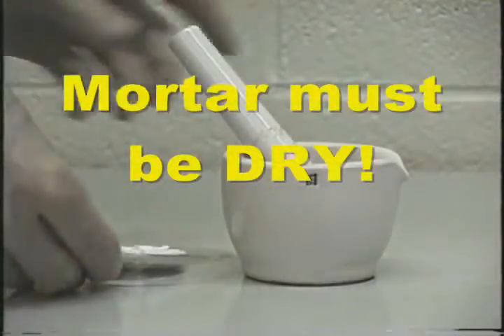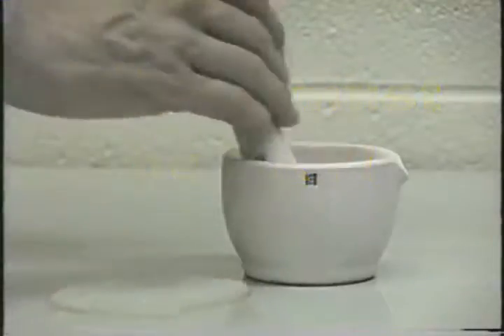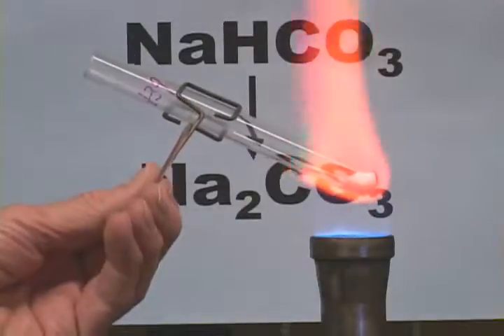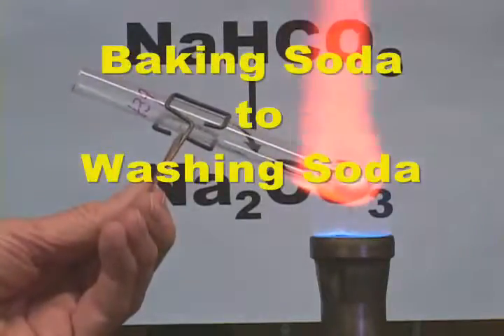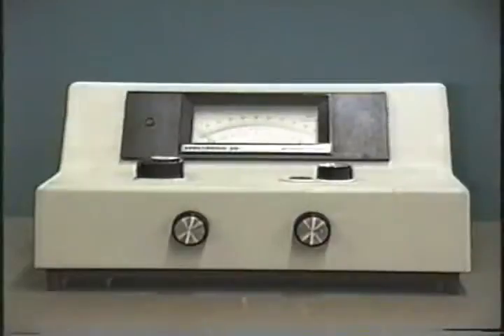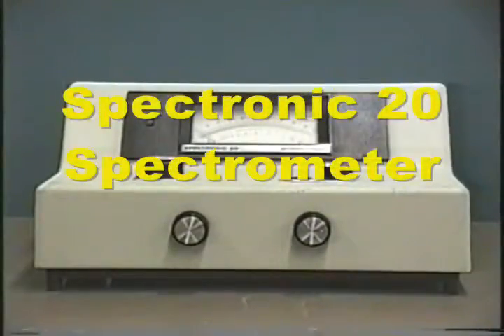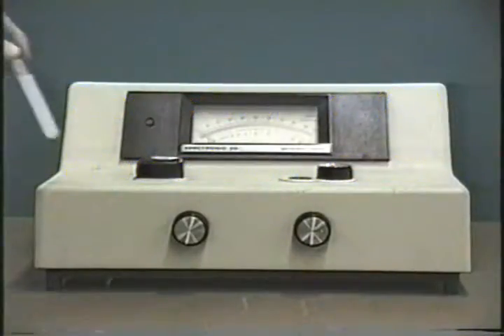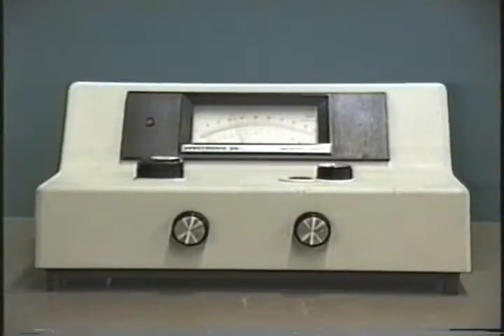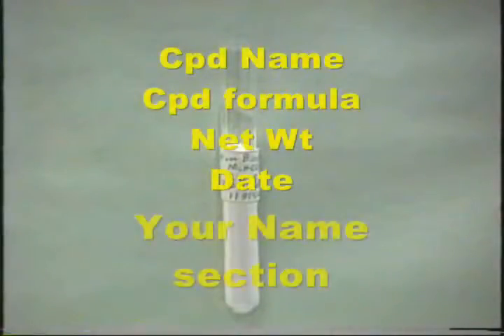Next week, in addition to doing the chromatography experiment, you will grind up your sodium bicarbonate in a mortar and pestle. You're going to quantitatively convert about half a gram of sodium bicarbonate into sodium carbonate. You'll analyze your product for chloride ion impurities by converting them to silver chloride and measuring their cloudiness in the spectrometer. Finally, you'll turn in the rest of your sodium bicarbonate in a neatly labeled sample tube.